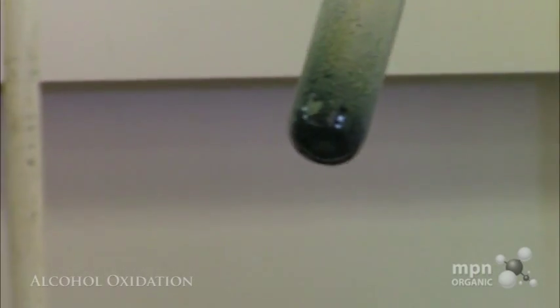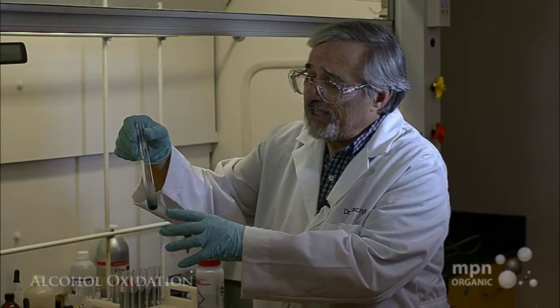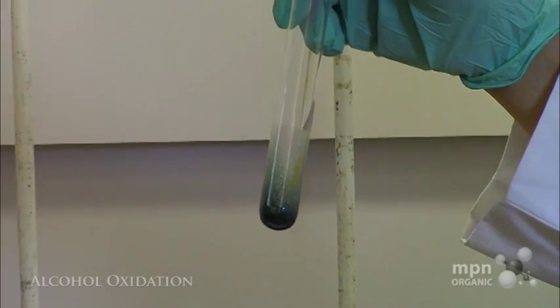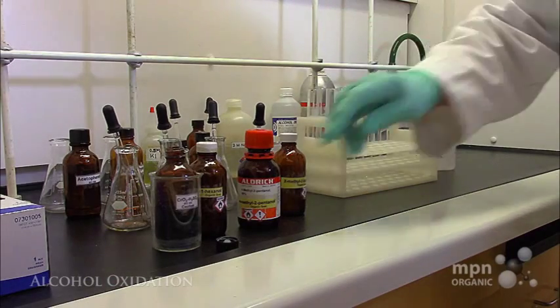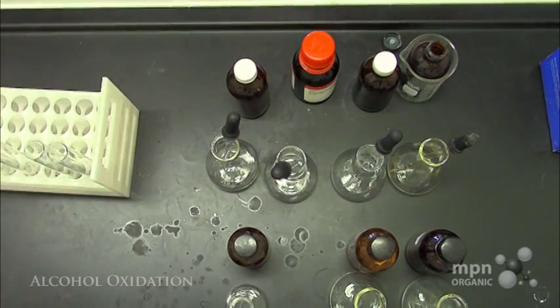So that's good. Now in this case, because this is a secondary alcohol, we actually now have a ketone in there, 4-methyl-2-pentanone. Okay. So that's the reaction for the secondary alcohol.